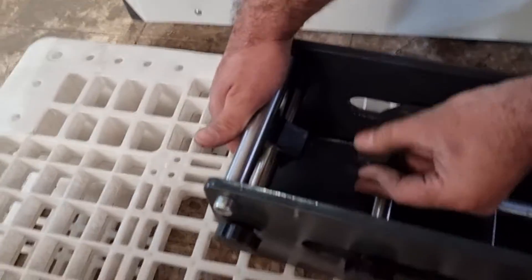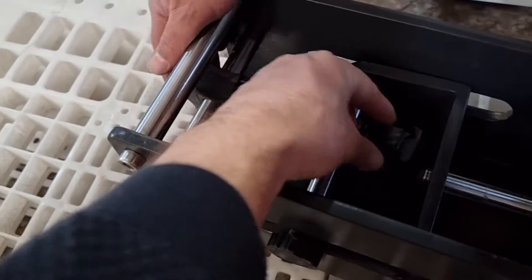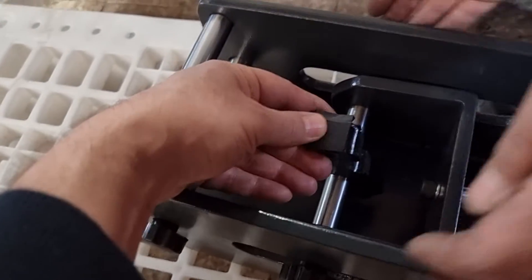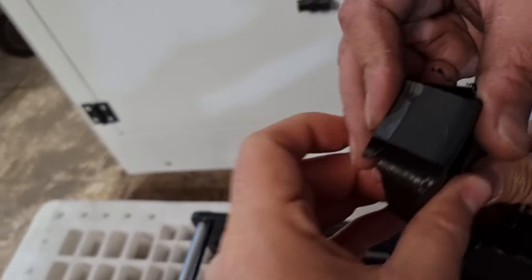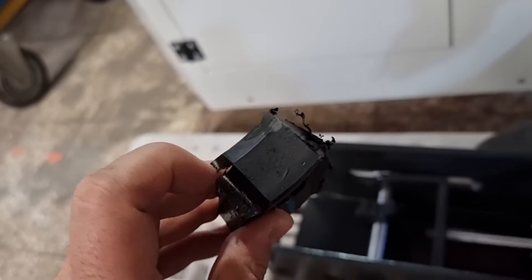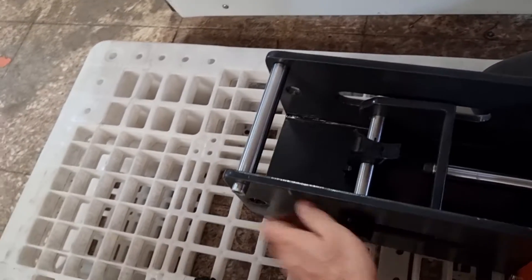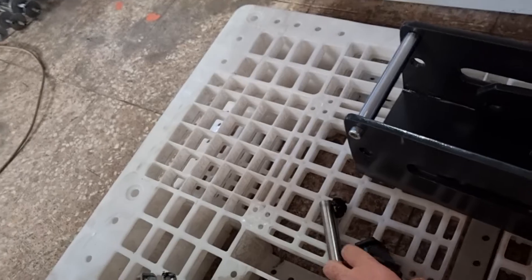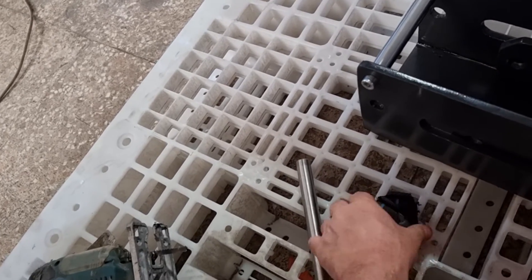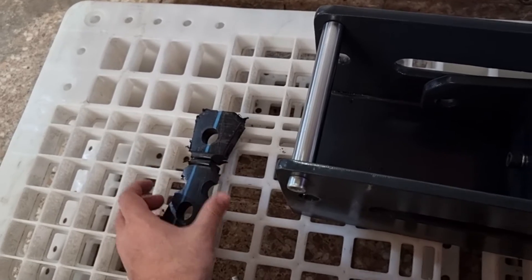You will see that this sample is brittle in the butt weld zone. Yes — this is a brittle failure. Before the pipe itself fails, the sample has already failed at the cross-section of the butt zone. As you can see, the butt weld is brittle.